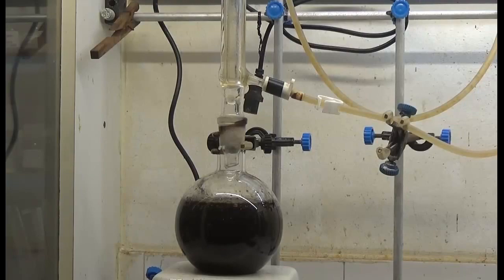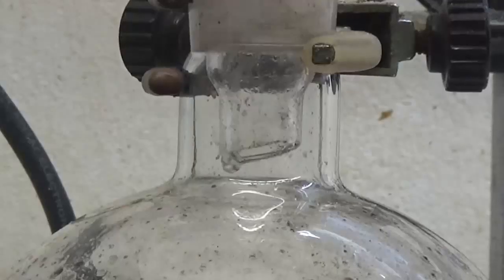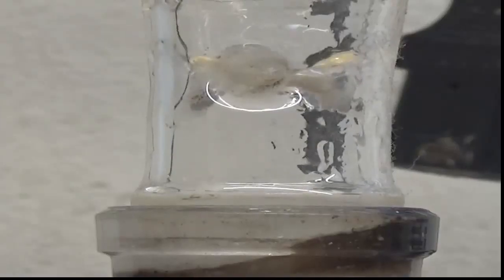Heat at reflux for one hour. In a short time, you can see the furfural condensing in the refrigerant.